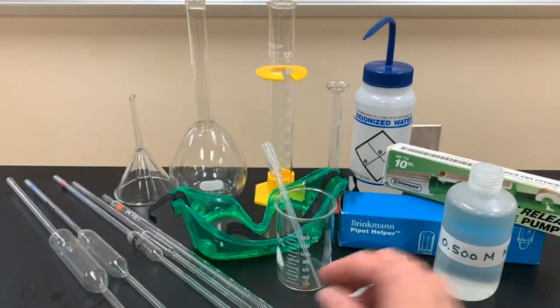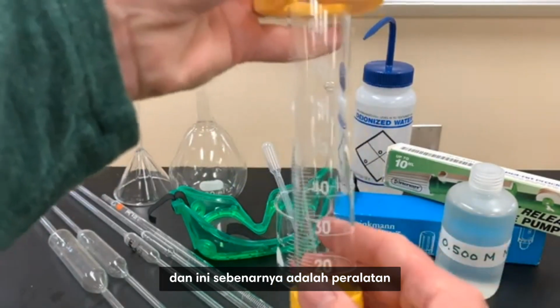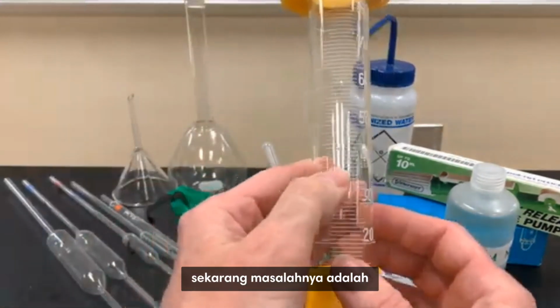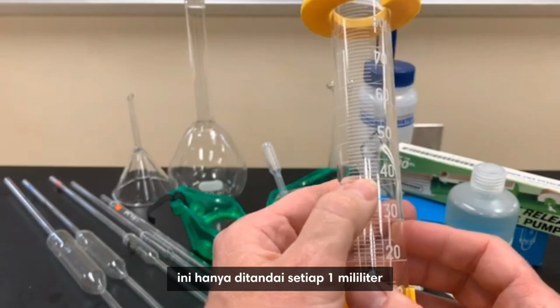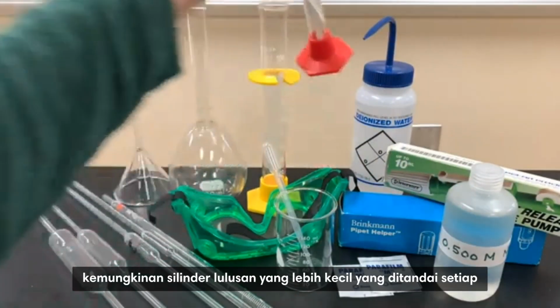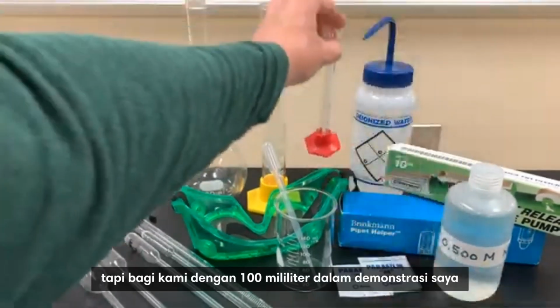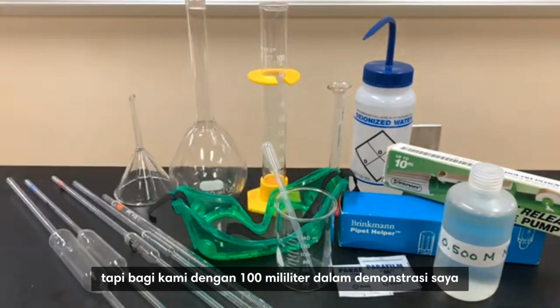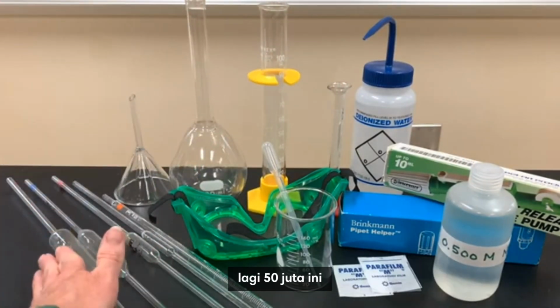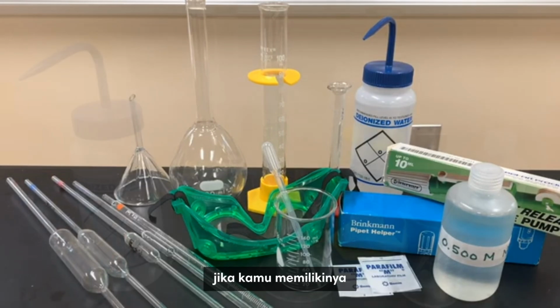Next, in every lab, there should be graduated cylinders, and this is actually the piece of equipment I'm going to use because everyone has a graduated cylinder. Now, the problem is these are only marked every 1 milliliter, so it won't be as accurate. There might be a chance that you have smaller grad cylinders that are marked every, again, 0.1 milliliters, but for us, with 100 milliliters in my demonstration, I will be using the 100 mil graduated cylinder. However, again, this 50 mil volumetric pipette would be the best option if you have it.